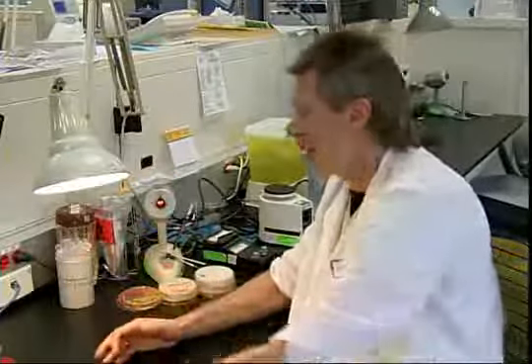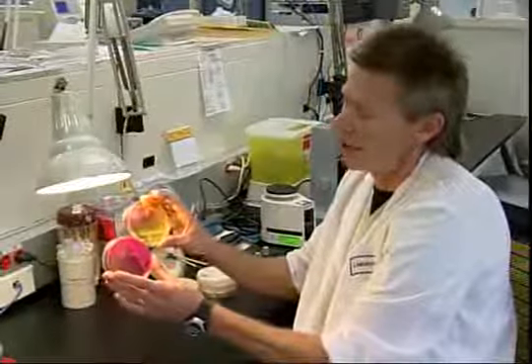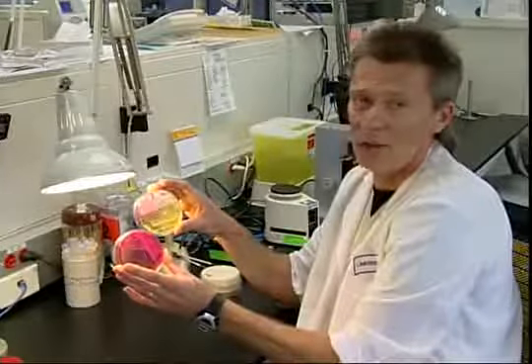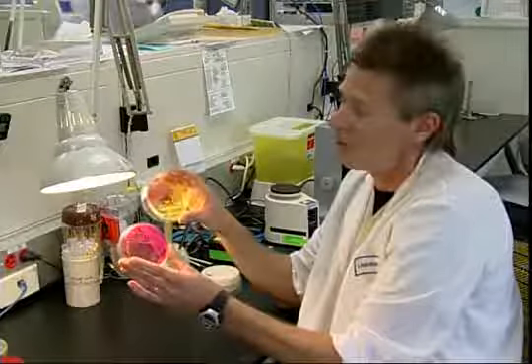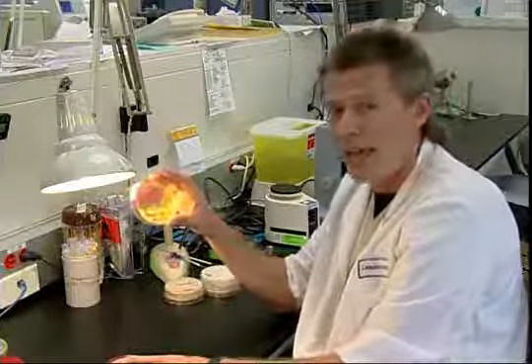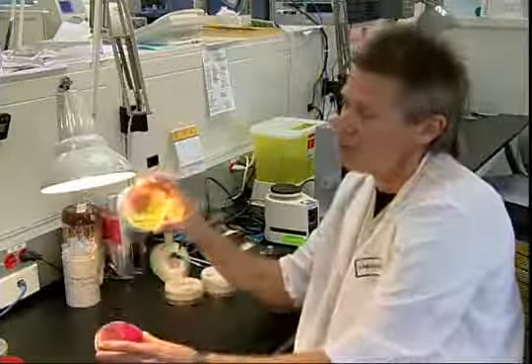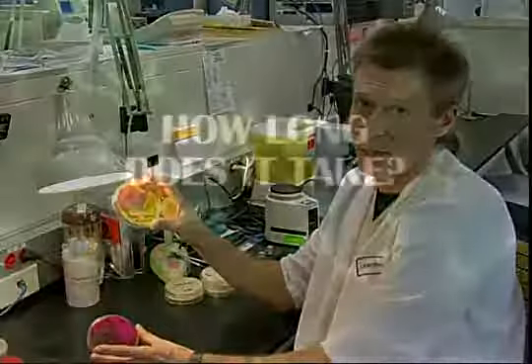And then finally we have plates that are selective and differential. An example is mannitol. Mannitol uses salt to make it selective, and it uses mannitol to make it differential. This is used to isolate and identify Staph aureus. Staph aureus is tolerant to salt, so it grows, and it utilizes mannitol, so it turns yellow. So if you compare these two plates, we know this plate has Staph aureus on it, and this plate does not, because this one is yellow.